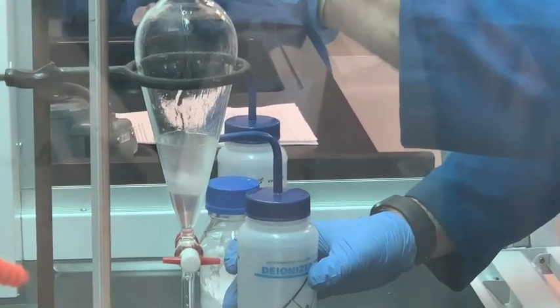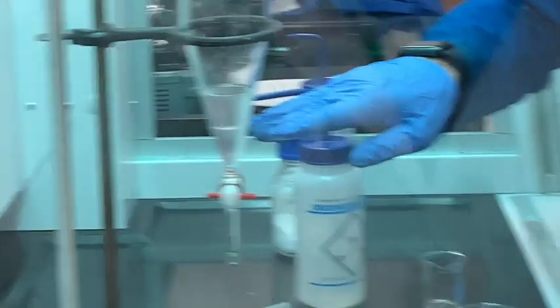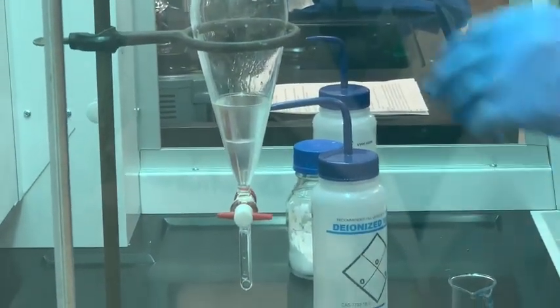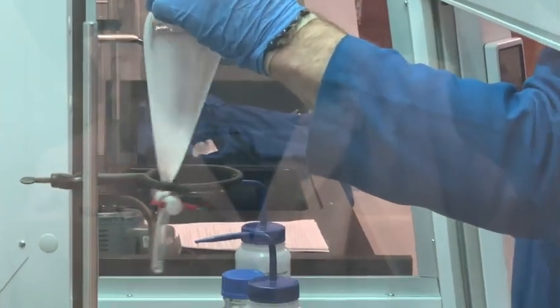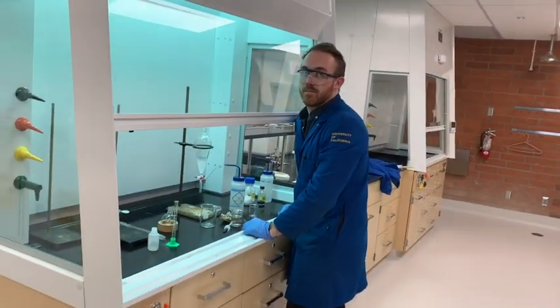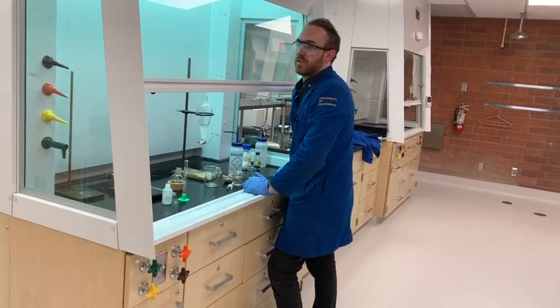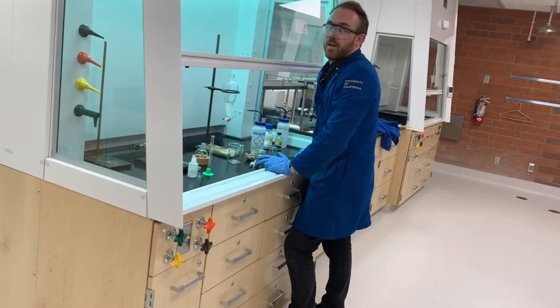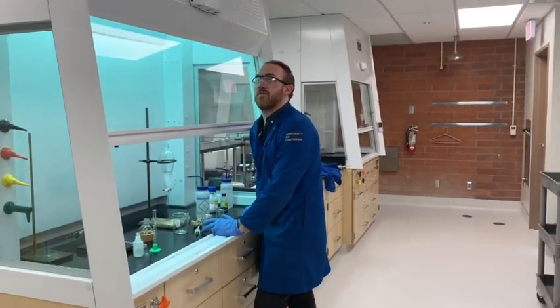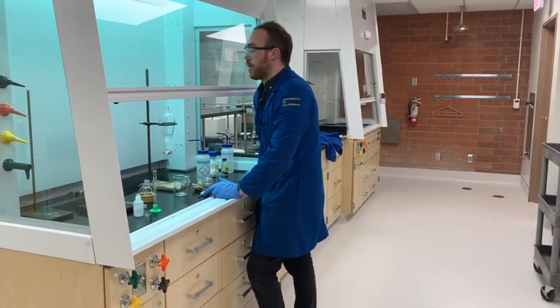When you do that, make sure you always double-check that the stopcock is closed before you attempt the transfer. Do your best to avoid transferring any solids at the bottom of the flask to prevent clogging. You can see a partition forming here — a phase barrier. The aqueous portion is probably sitting on the bottom because water usually has a relatively large density compared to organic solvents. However, we're about to use some DCM, and that's going to change things — DCM has a density of about 1.33, so it's going to be the denser of the two layers and will sink to the bottom.